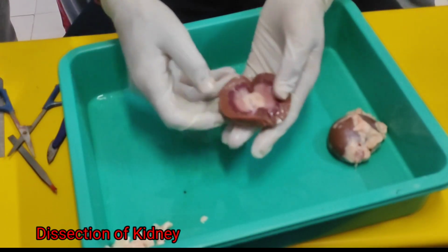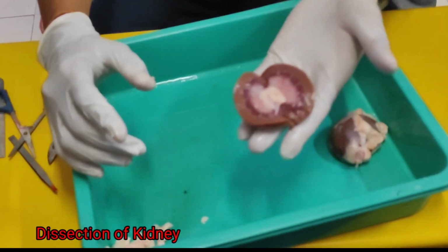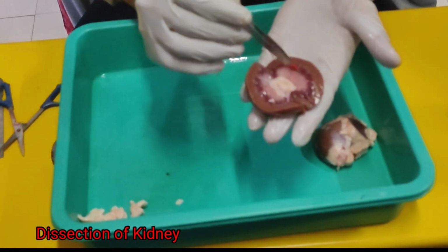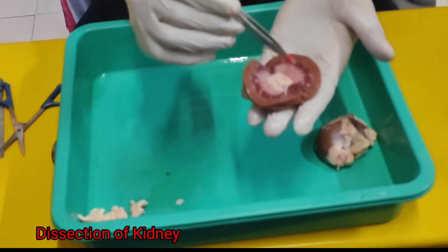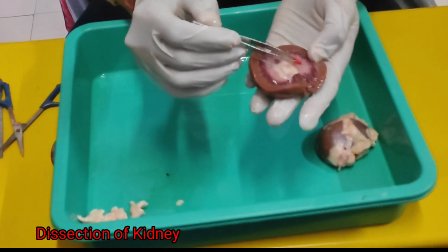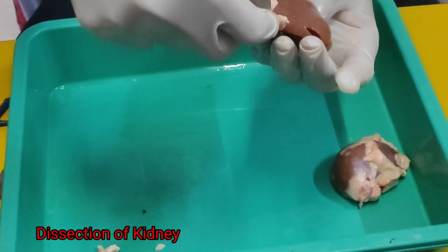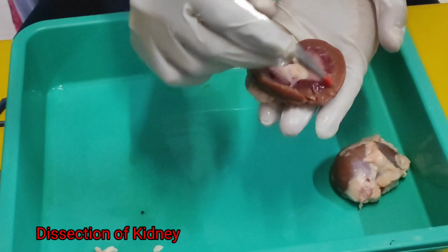Okay, so you will see here, this is the internal part of the kidney. In this region, this darkest brown part is basically called the medulla. This part is called what? Medulla. And below the medulla, you will see this is called the pelvis region, where all the renal arteries, renal veins, and the ureter are connected, these whitest things. Above that, this is called the cortex region of the kidney.